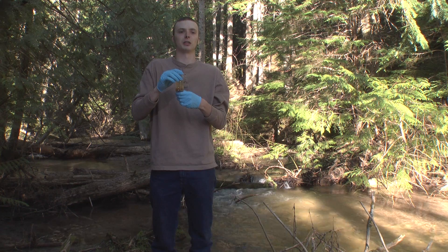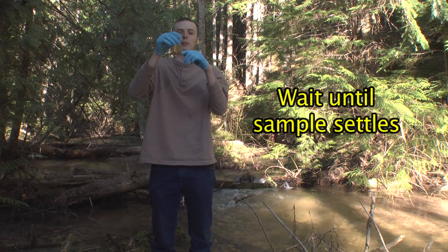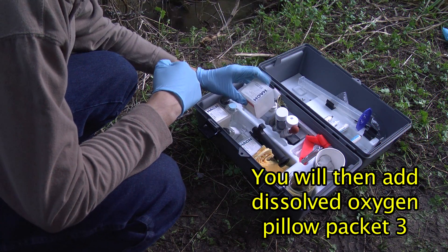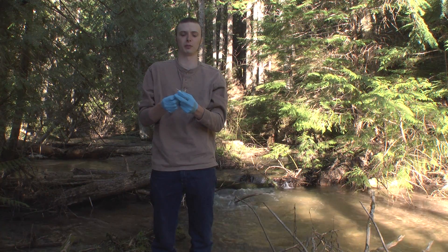After you've added your dissolved oxygen pillow packets one and two, you're going to want to wait until it settles — until the floc looks like this at the bottom of your bottle. Once your floc has settled, you'll be adding your dissolved oxygen number three pillow packet. Remove the stopper carefully and add your pillow packet number three.